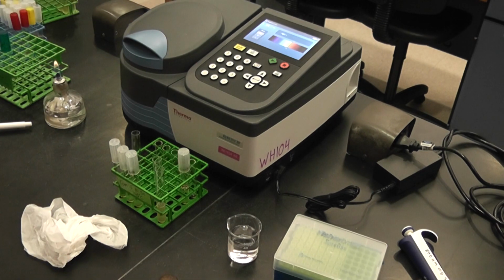Now I'm going to figure out the right dilution to give us the best results. I performed this in the past, and I believe I have it written down. Let me find it. Yeah, I don't have it here, so what the actual absorbance is, but that's what we're going to figure out, and that'll be on a subsequent video.